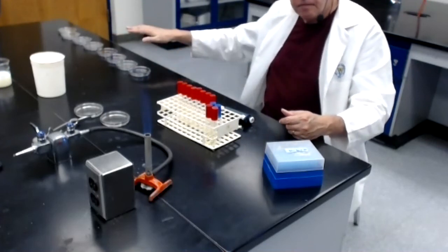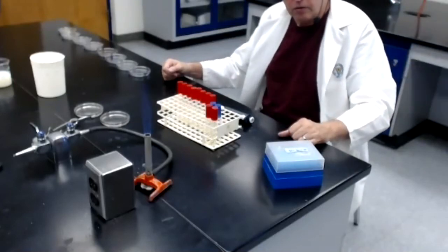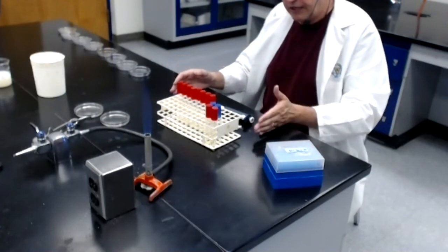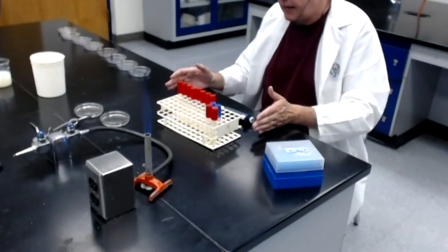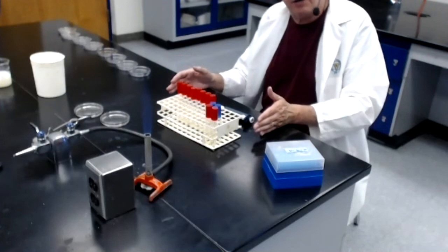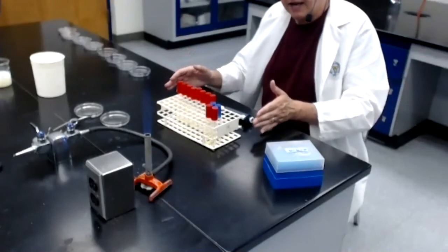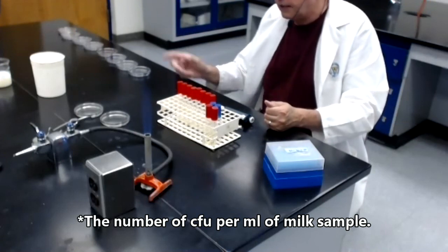Let them all harden, and I'll stick them in a 37-degree incubator to give them a chance to grow. I'll come back tomorrow. I will try to identify the plates that have between 30 and 300 colonies. Whichever plate or plates have a number of colonies that falls between 30 and 300, I will count the number of colonies. And then I will be able to use that number of colonies to calculate the number of colony forming units in the original milk sample.